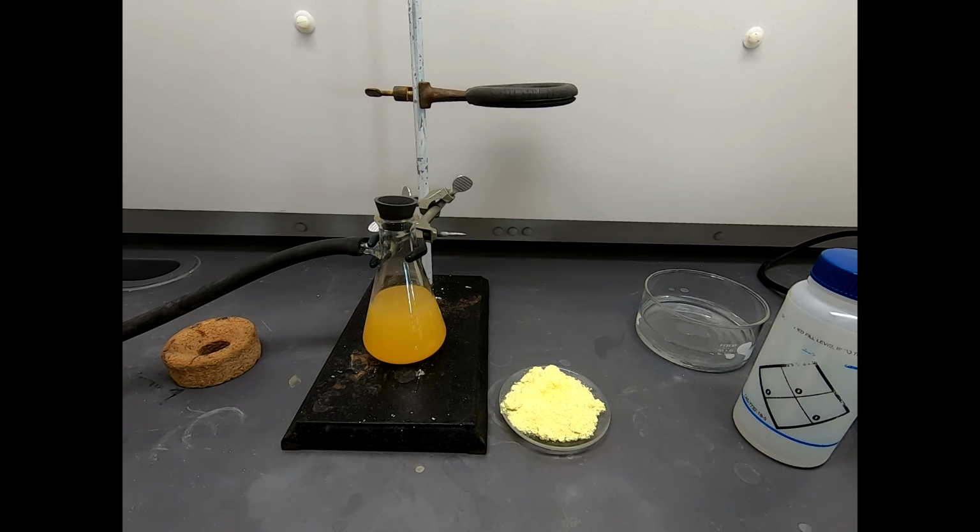So we would expect a high yield for this reaction. I will note one thing: I haven't taken any of the characterization data for this compound yet. I'm a little curious to see what things look like, because when I was spreading the material out on the watch glass, I detected a sort of cherry smell. Cherry smell is associated with benzaldehyde, and we did have excess benzaldehyde, so I hope I got just about all of that rinsed off of the solid through the filtration.